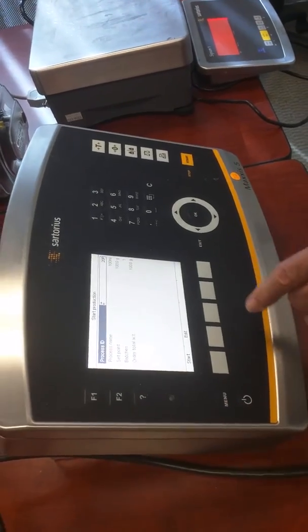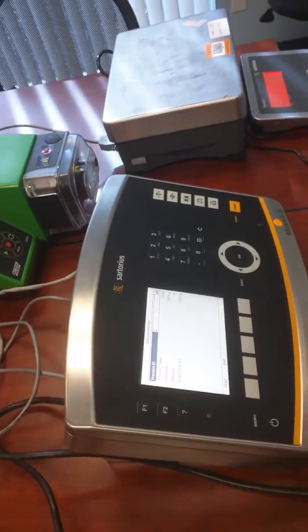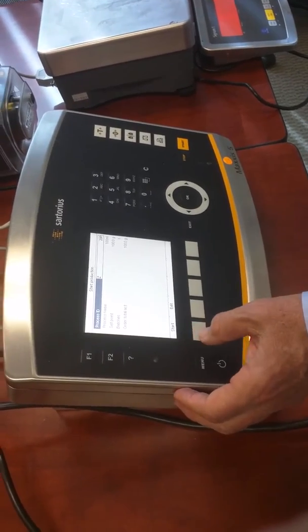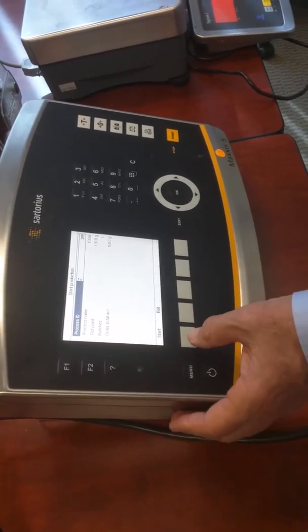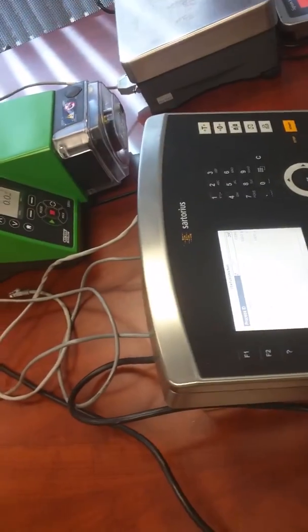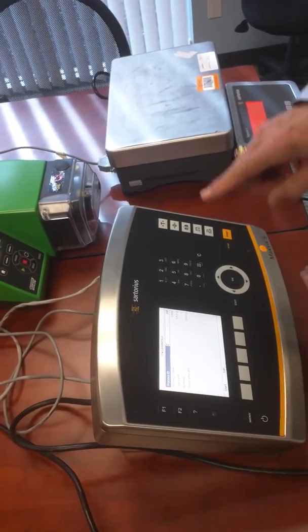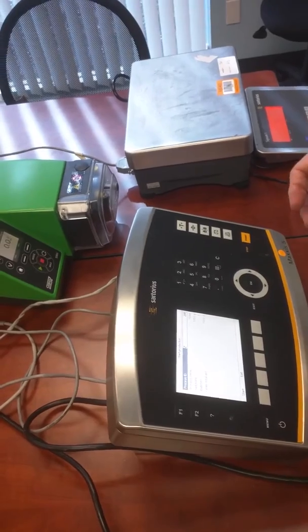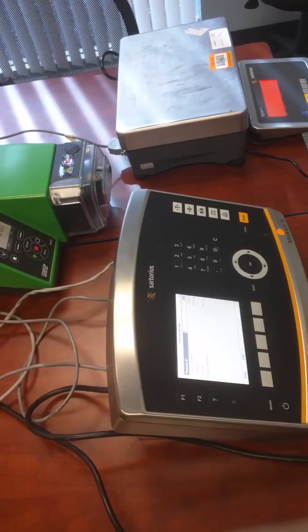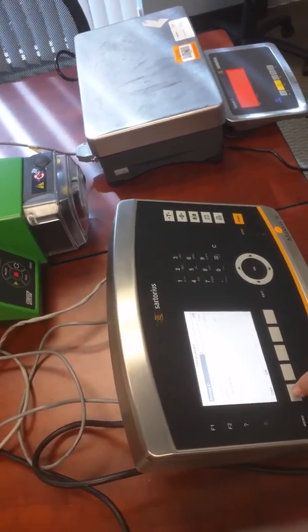Right now, we need to go to the pump in a minute here. But anyway, so now start or edit. If I hit start, it's going to start the pump. Now, if the pump was pulling from a liquid and putting it onto here, when this gets to 90, it should drop down to the mid-range. And then when it gets to 95, to the fine range. I don't have any way to do that, but we're going to assume that it's operating correctly.